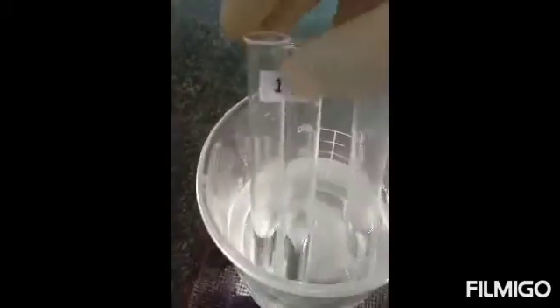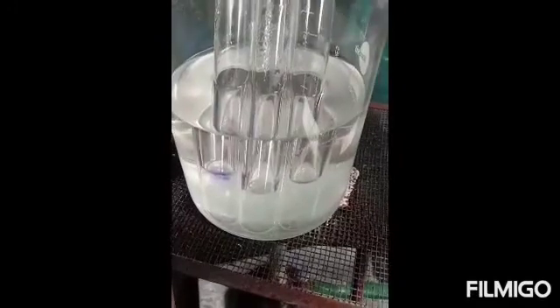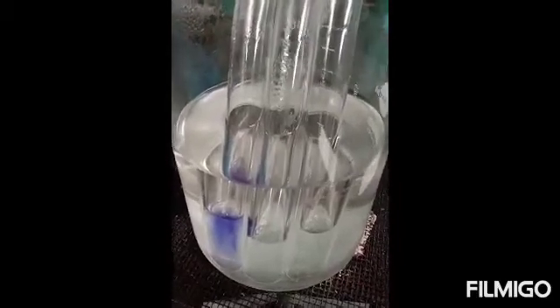The tubes are kept in the boiling water bath for a few minutes. We can detect a violet-purple color in the first test tube, in which amino acid was taken, and within one to two minutes we can detect the purple color in the second test tube also.